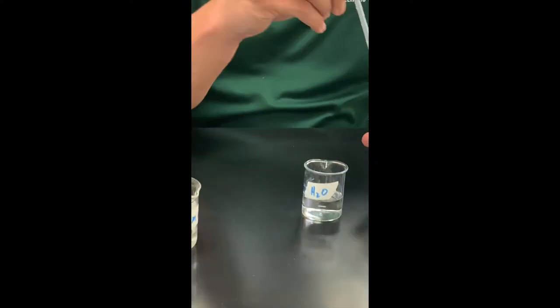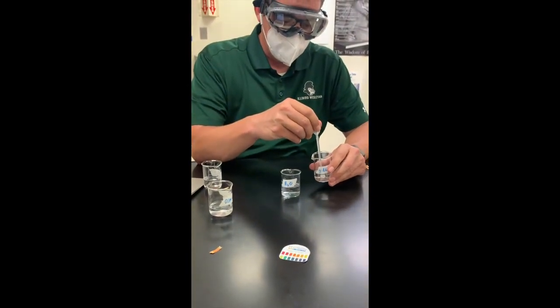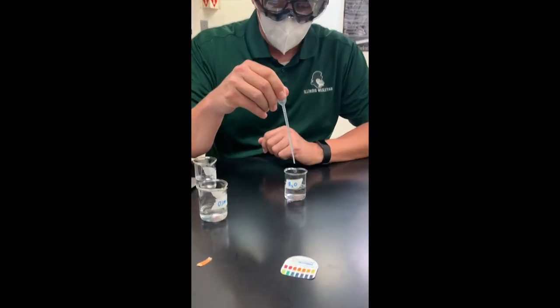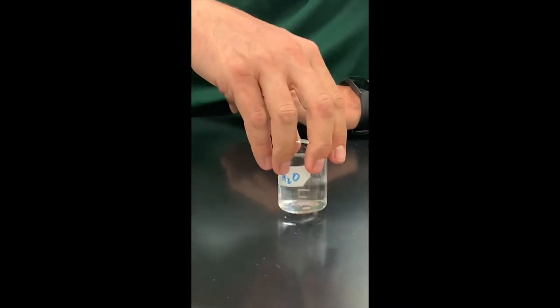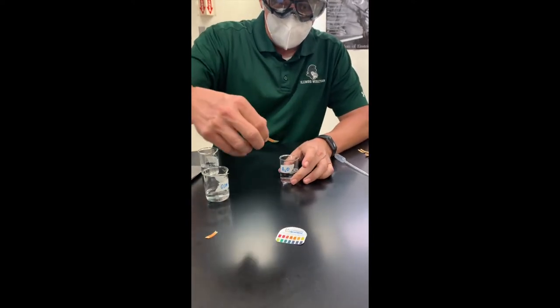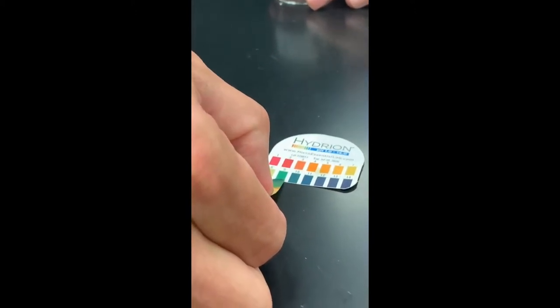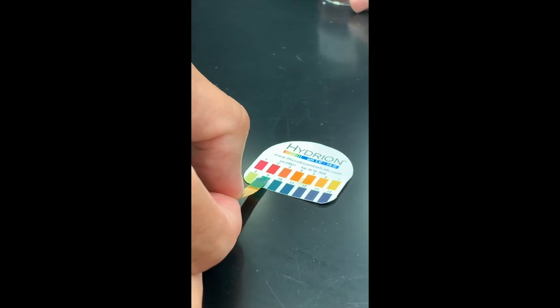So what we're going to do now is we are going to add one milliliter of NaOH — sodium hydroxide, which is hopefully you know a base — to our water, and we're going to swirl it up a little bit. We're going to put a piece of pH paper in there and measure the pH again. And this looks to me to be sitting right around a nine for pH now.